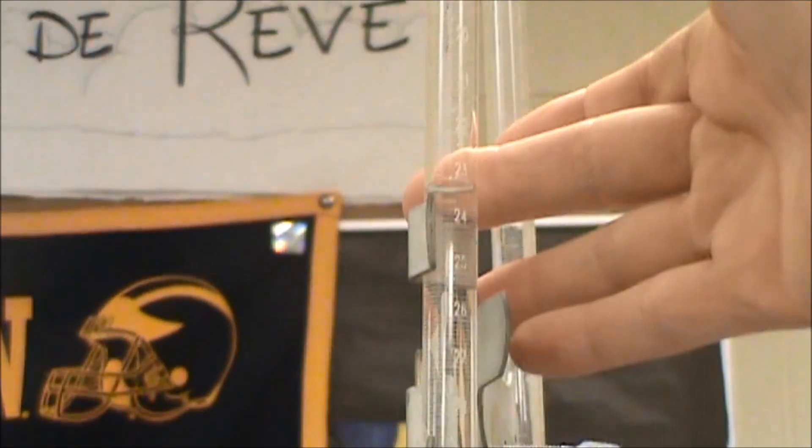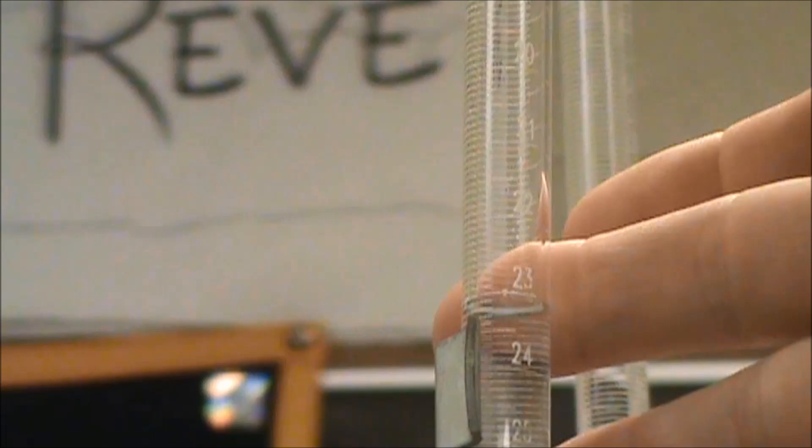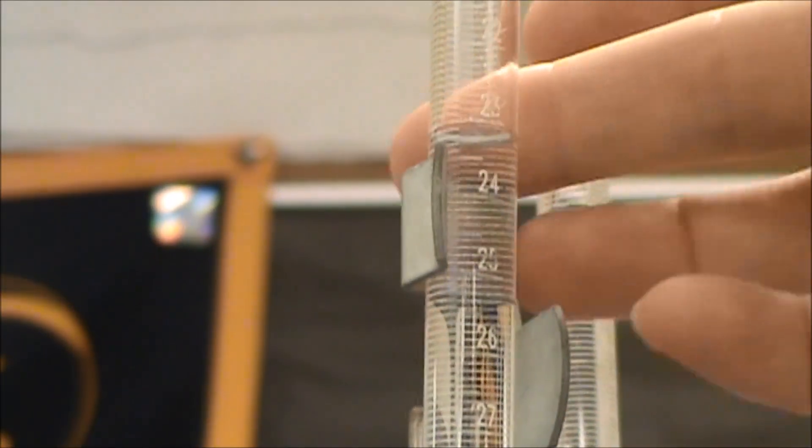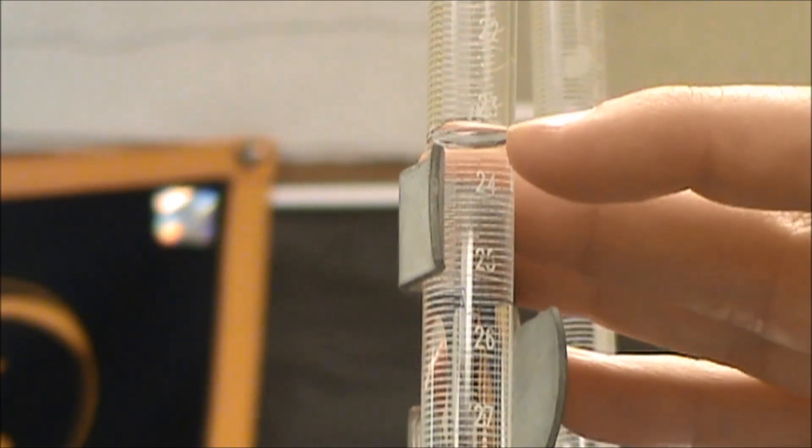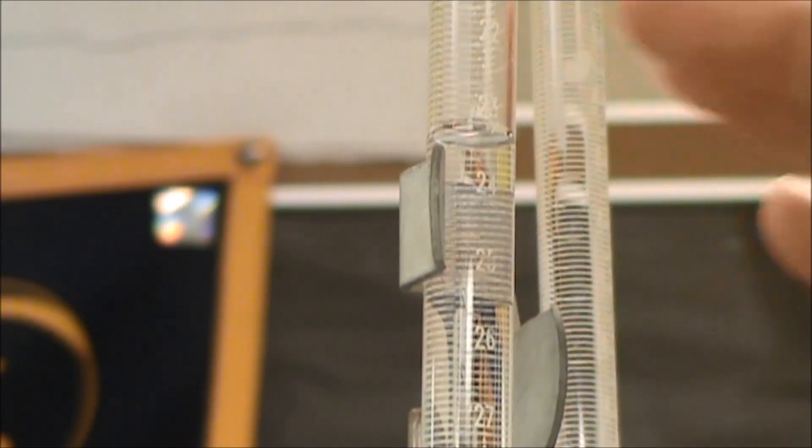Let's see if I can zoom in on there. So the bottom of our meniscus is right here. There's 23, there's 24. Between 23.1 and 23.2.